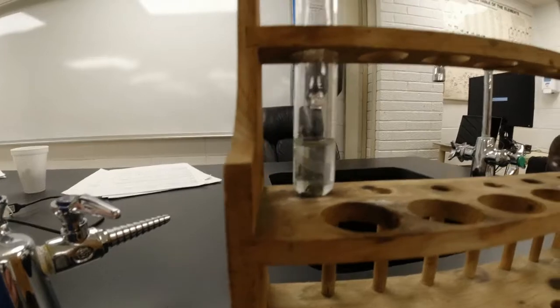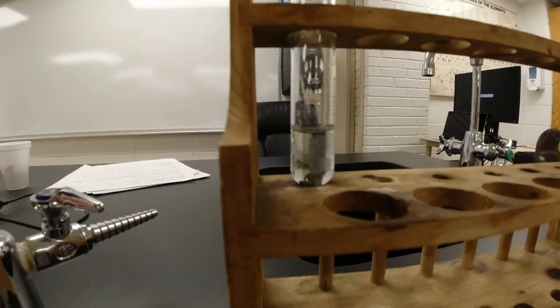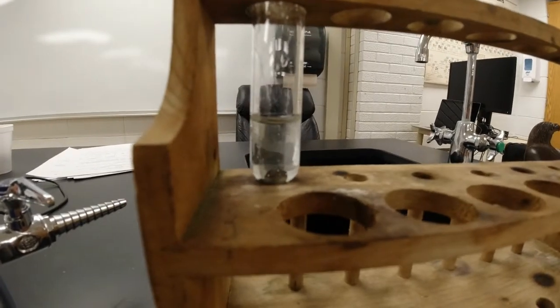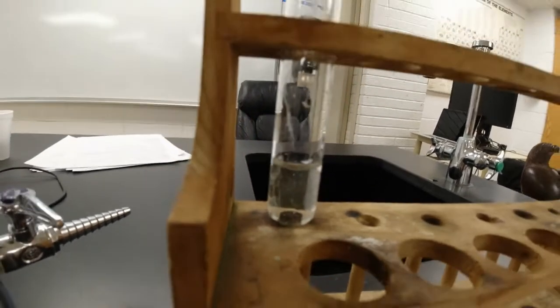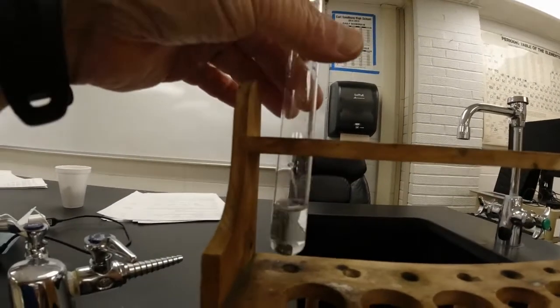All right, you guys remember that from that lab that we did, or the first thing that we did, we put that chunk of zinc in the blue solution? Well, I let it wait overnight, and here's what we got. If you look closely, that chunk at the bottom has kind of an orangish color to it. It might be easier even to see from the bottom, but it's got kind of an orangish color to it.